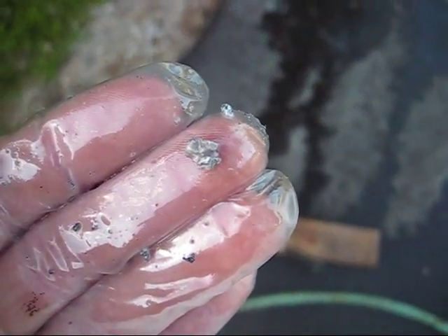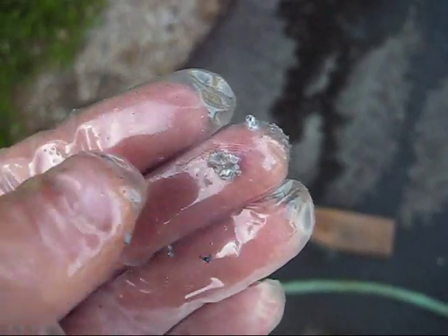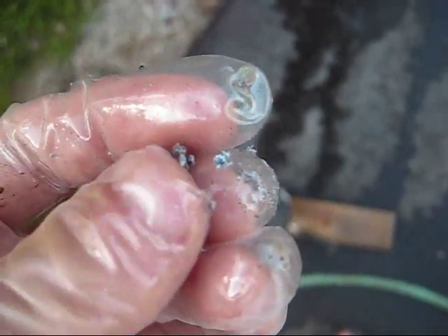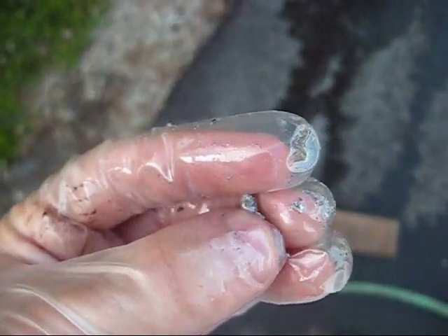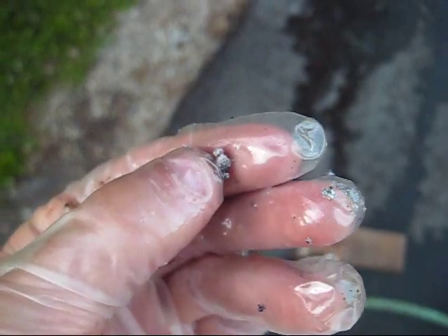Here in my hand is the largest piece of sodium I have so far found from this synthesis. It's a very metallic piece and flexible — I can bend it between my fingers since it's a very soft metal. See, I just bent it in half. And yeah, that is truly a piece of sodium.